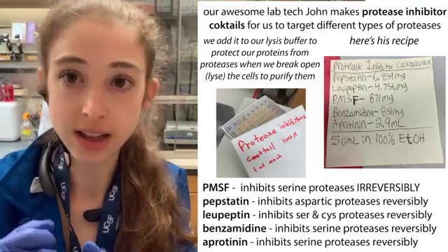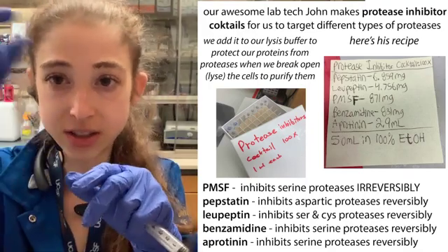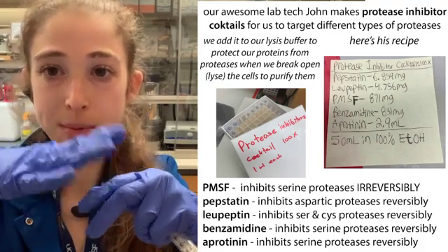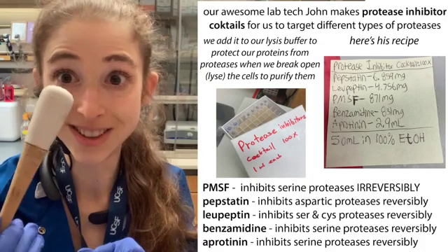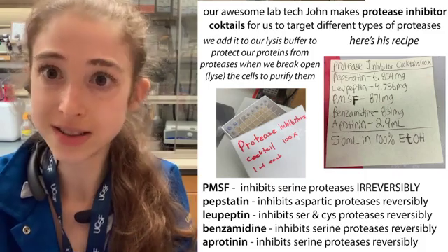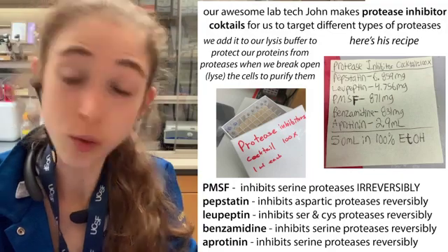Sometimes protease inhibitors come as a little tablet. A tip: don't try to dissolve the tablet as-is — crush it up first. What I like to do is take a tablet, stick it in a weigh boat paper, fold it up, and grind it. A mortar and pestle works well for this. Grinding it up makes it much easier to dissolve, similarly to how grinding up cells makes it easier to break them open.